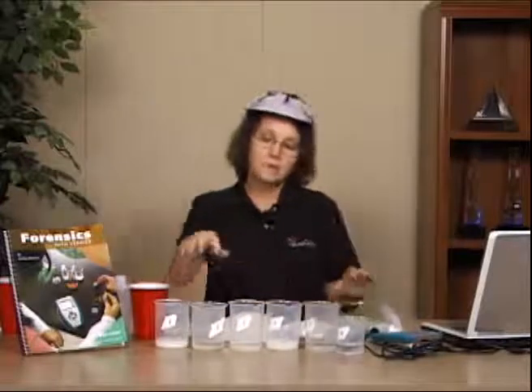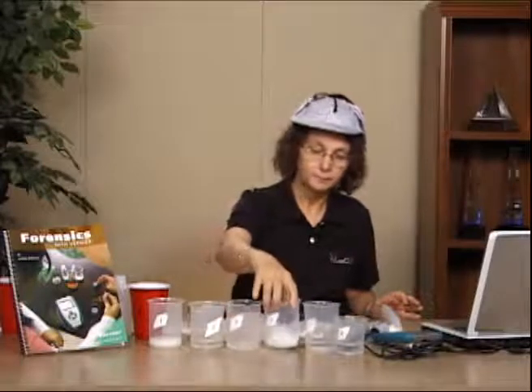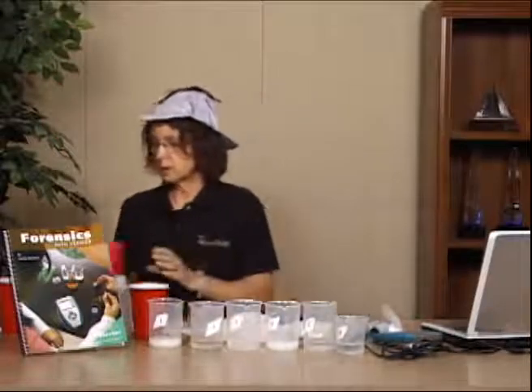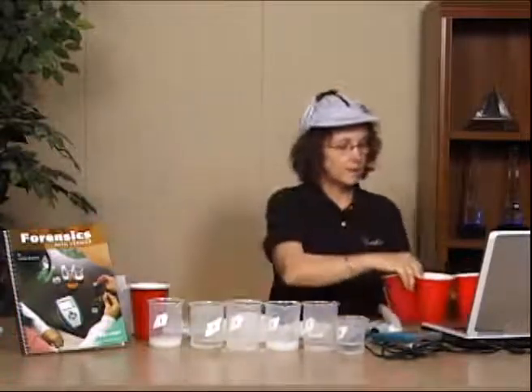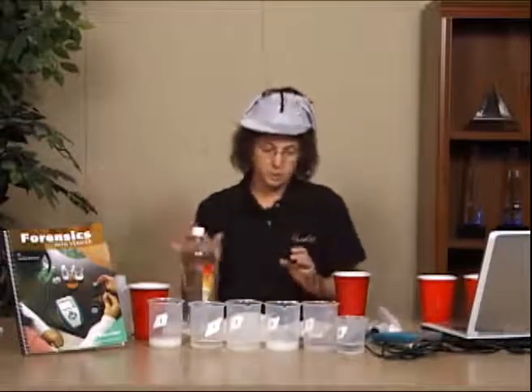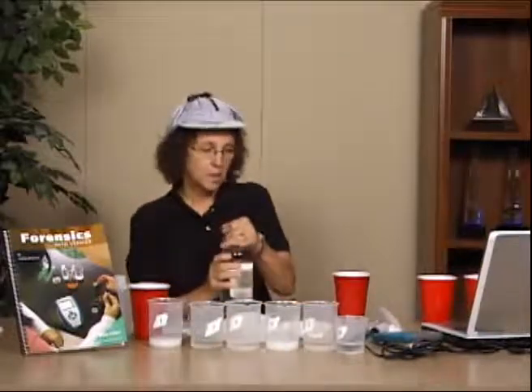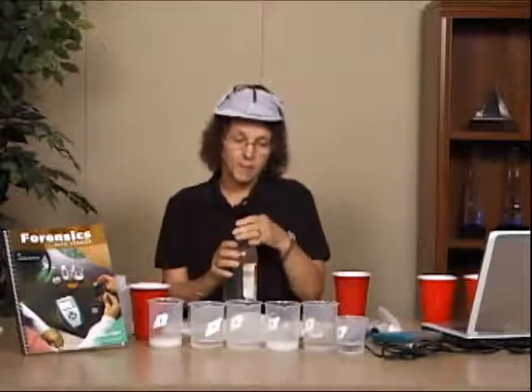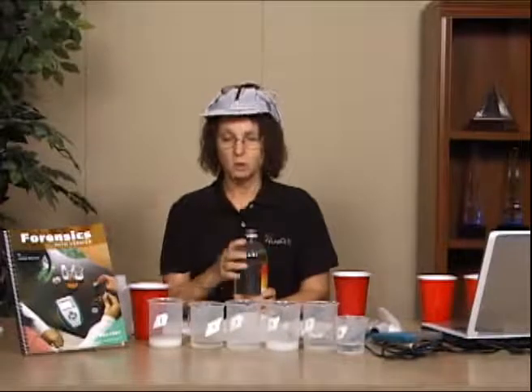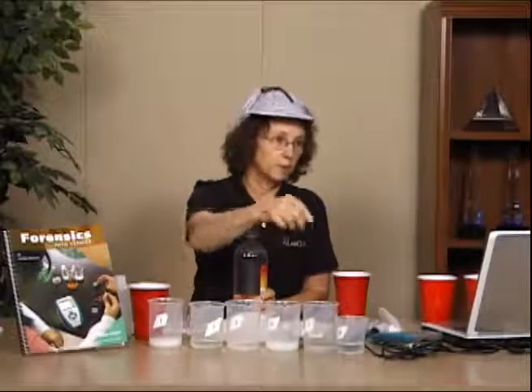So as these things are swirling, and as you are waiting to see the relative solubility of these, that's one of the things that you can be doing. The other thing that you could be doing in this particular lab is we see how they react to vinegar. And all you're looking to do is to see if, in fact, we get bubbles or don't get bubbles, and how violently it bubbles. And as we are swirling, in my classroom, I actually have a stopwatch, so somebody's sitting there with a stopwatch, and they say, okay, swirl, and they swirl. And then when it hits the next 3 minutes, you'll hear them say, okay, swirl, and they stop what they're doing, and they swirl.